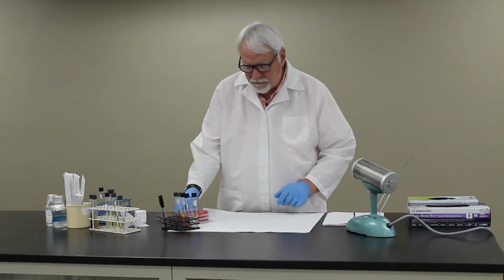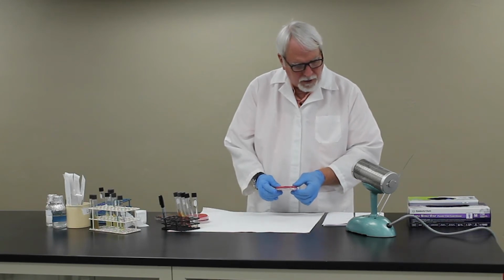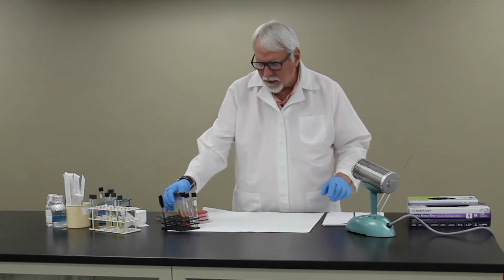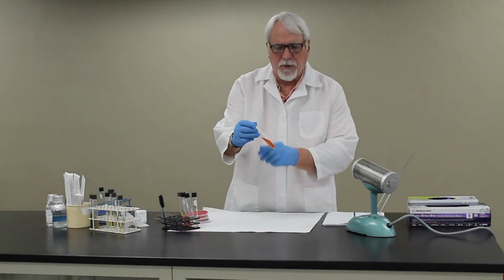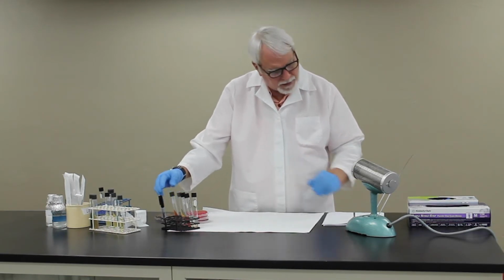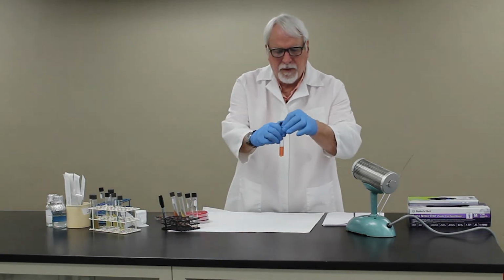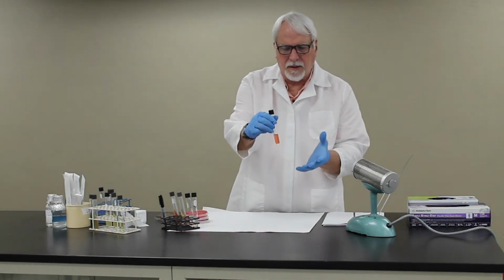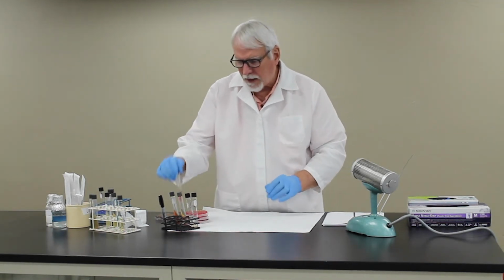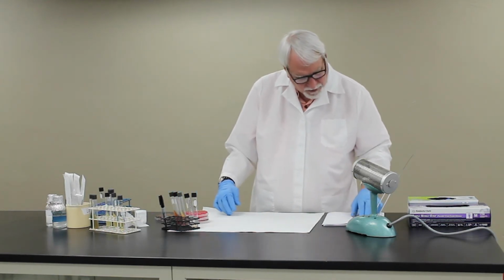So in this exercise, with each organism, you'll be streaking a blood plate, streaking for isolation to look at the colonies. You'll be inoculating the TSI, and if you remember, you streak the slant and stab down into the TSI medium. You'll get glucose phenol red this time, so it's basic phenol red broth. It just has glucose in it this time. And again, if it turns yellow, then it indicates it's producing acid from glucose.